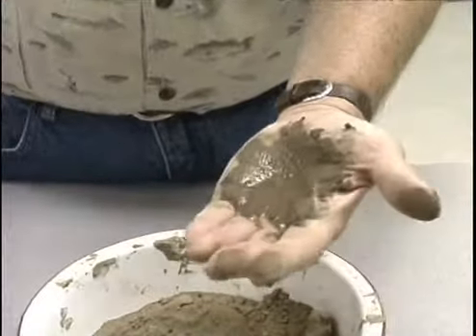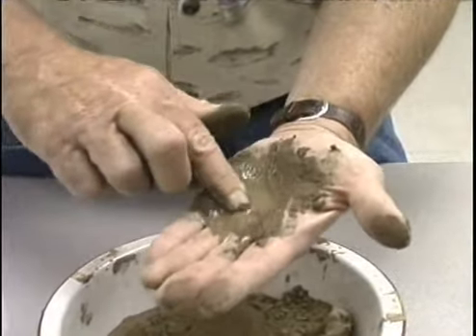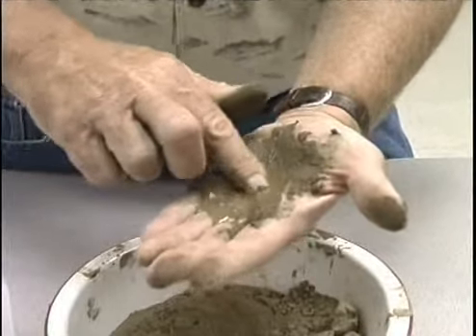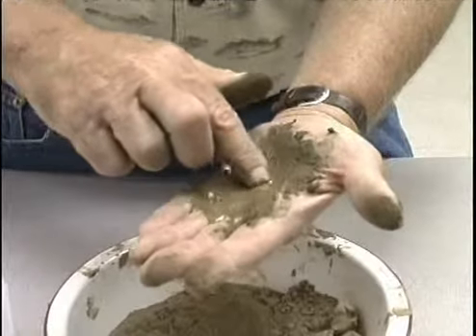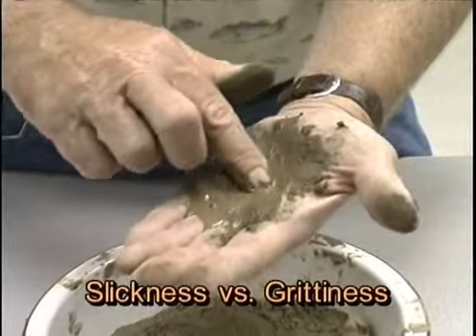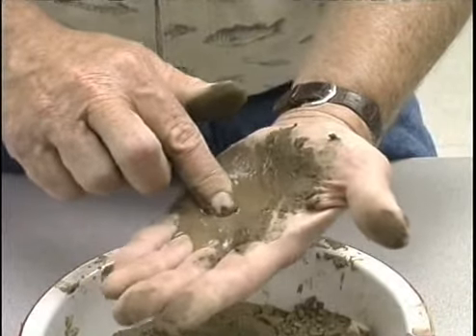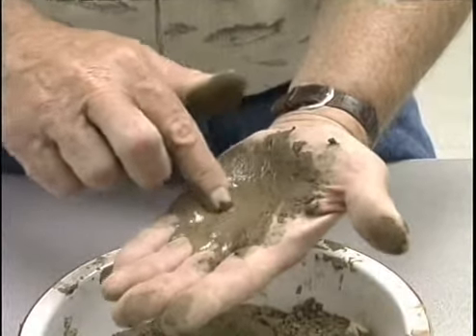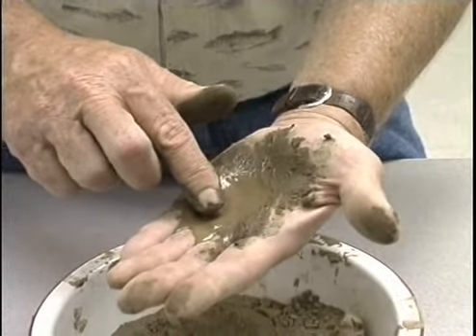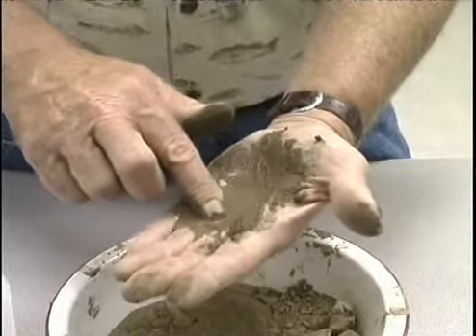Now what I'm doing here is to determine the amount of grittiness or smoothness that's in this soil. I'm rubbing this soil sample. I've got it excessively wet, and I'm trying with the tip of my finger to determine how much grittiness versus smoothness or slickness there is in this sample. It says, does the soil feel very gritty? Well, that's a no. There's not very much grit in this particular sample. So it is not a sandy clay loam. Next step says, does the soil feel very smooth? There is a considerable amount of smoothness here.